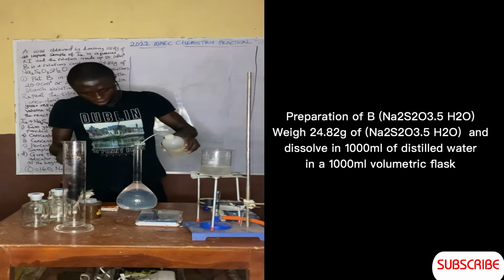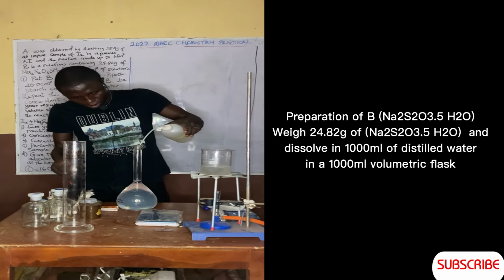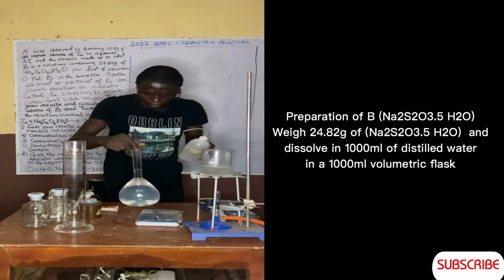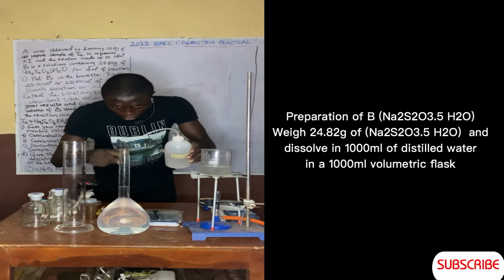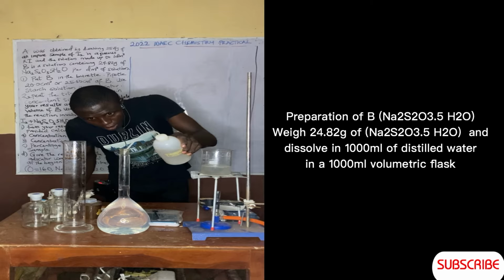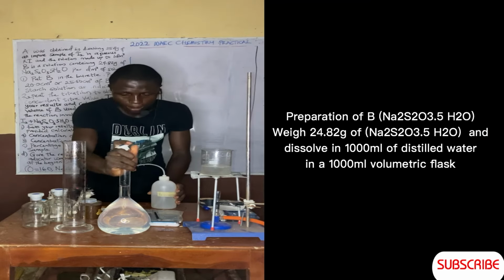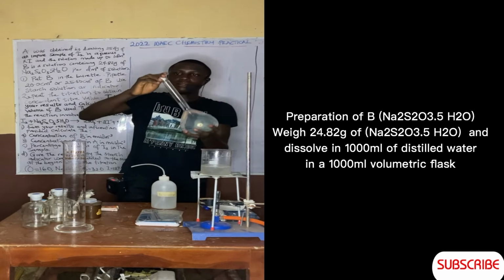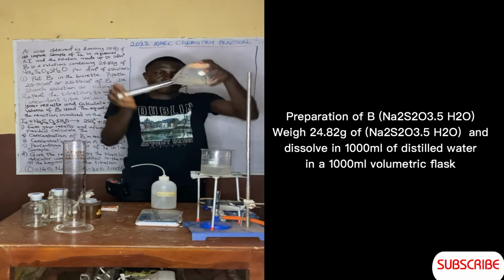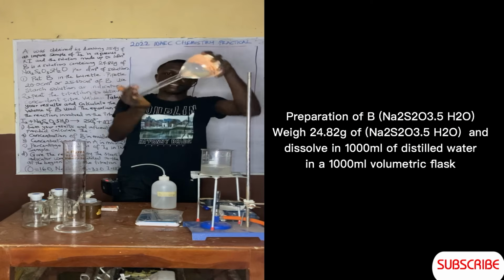So now let me use this. You can see I'm almost there. So that's it, exactly. You can see everything has completely dissolved.